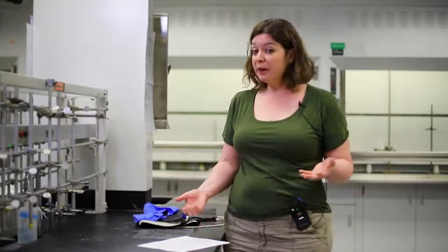You could inhale or breathe in materials. The most obvious one is vapors or gases, but you could also inhale solids or liquids, and if these are dangerous, they can cause harm to you. So to avoid inhaling potentially hazardous materials, in a chemistry lab, we may have you use a chemical fume hood, and we'll show you what one of those is. We may have you work in a ventilated space, or we may have you work underneath a fume hood that's on a stove or a cooking appliance. Or we might have you do this outside.